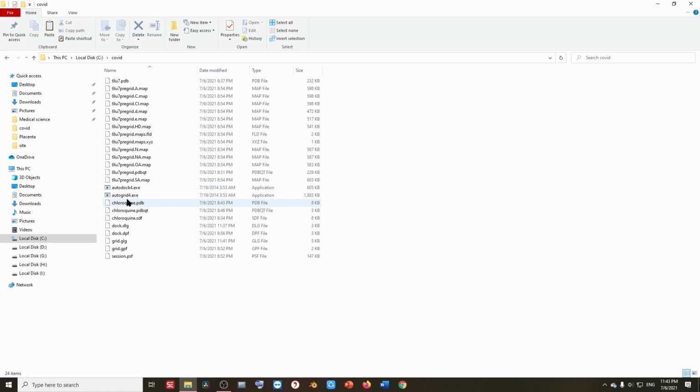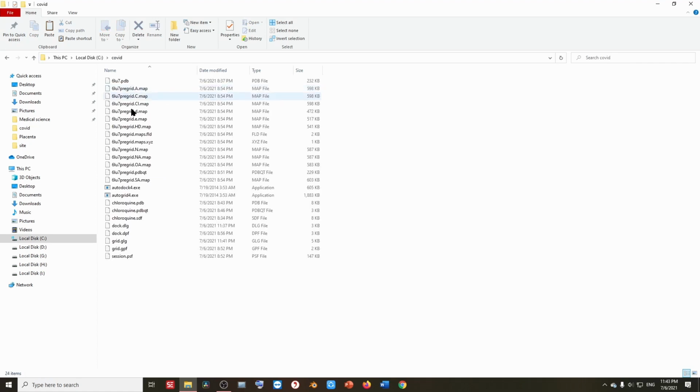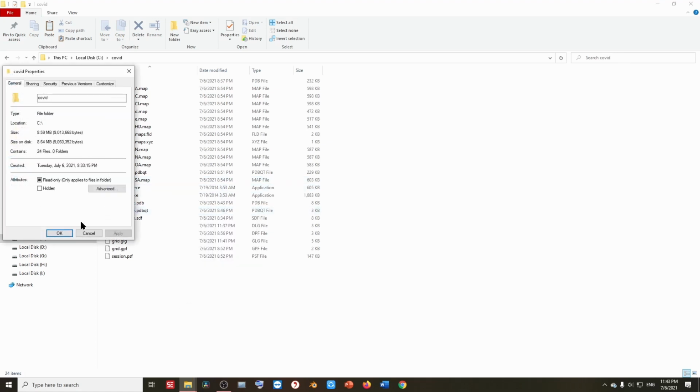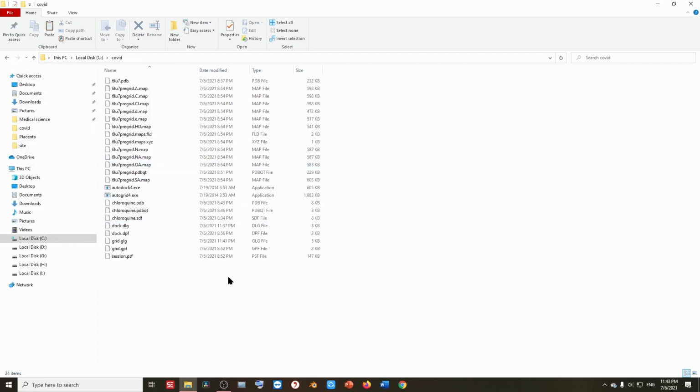So the first step is that we have to copy these two files from the Program Files folder into another folder, possibly in the C drive, and that folder name should not contain any space. If it was like this, it would again cause an error. So let's remove any space. There shouldn't be any space in the folder name. This is very important. Next, as I've discussed, we have to uncheck read only.